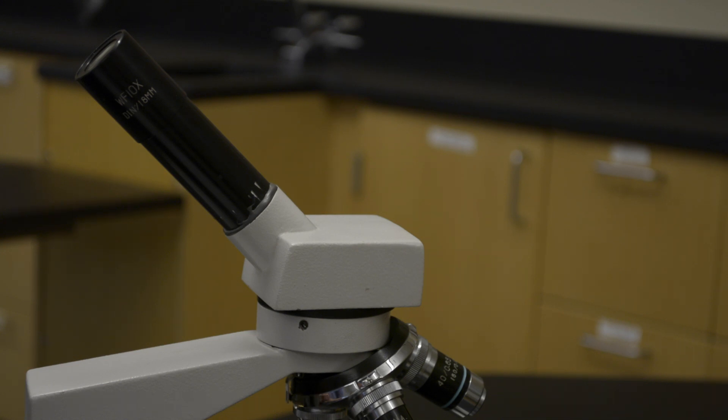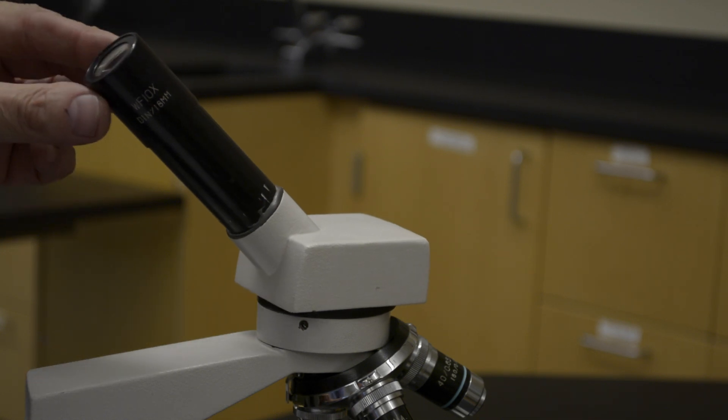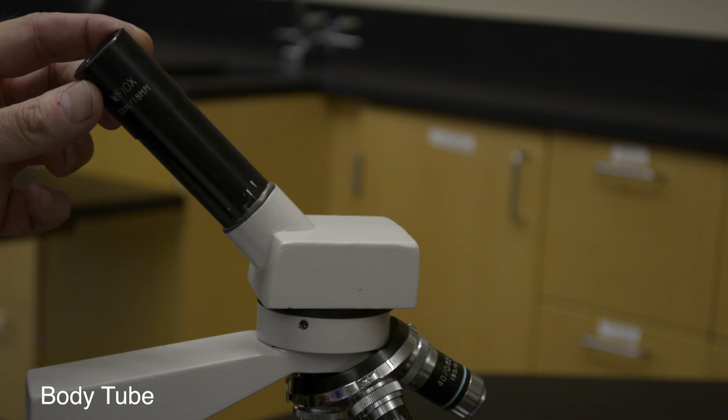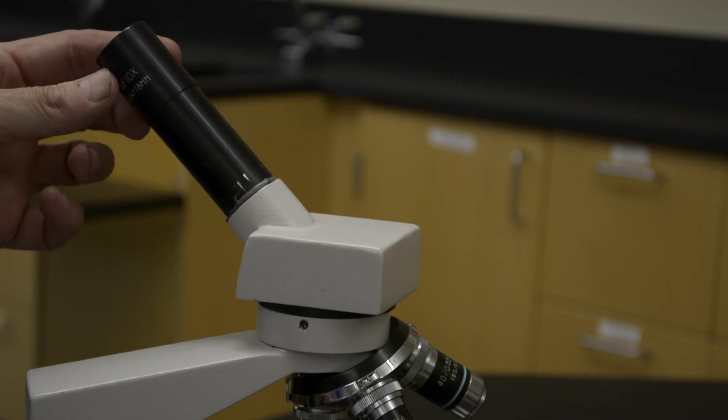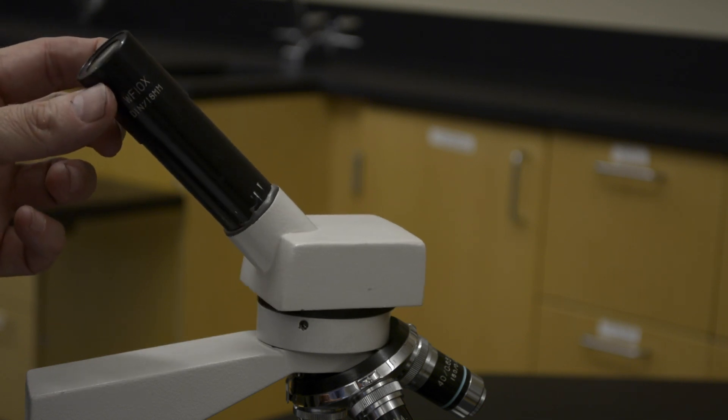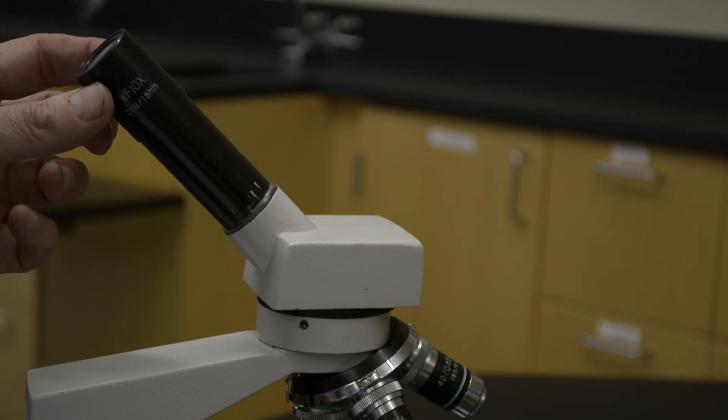The eyepiece is contained in a movable tube called the body tube. This tube can be moved or adjusted to allow more than one person to look through the eyepiece.